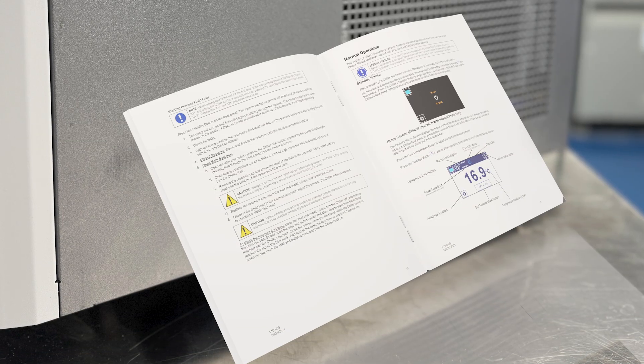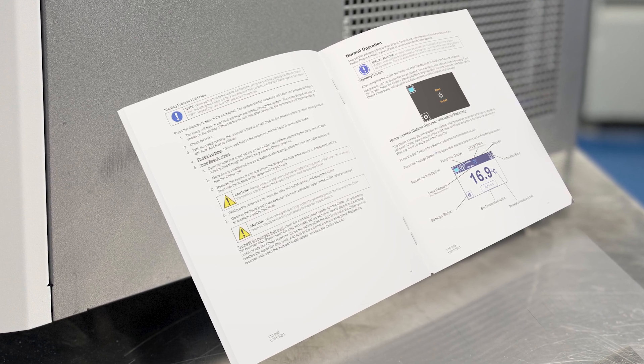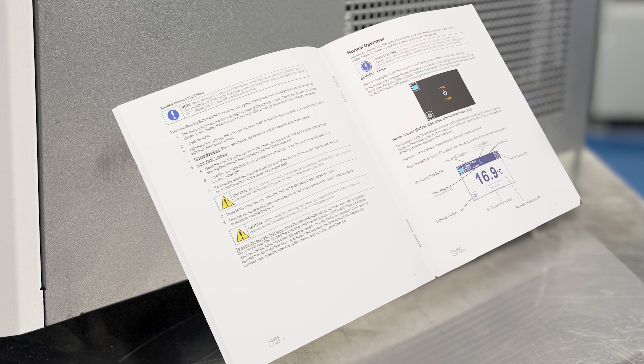Reference the user manual for setting temperature in centigrade or Fahrenheit units.